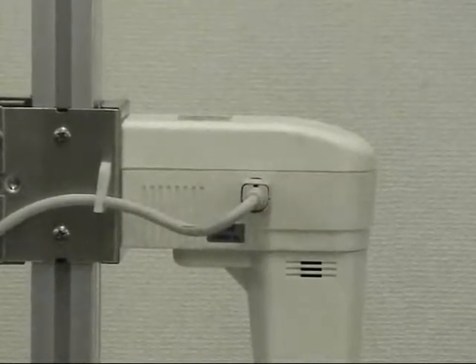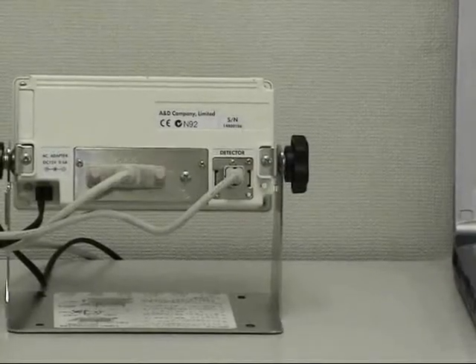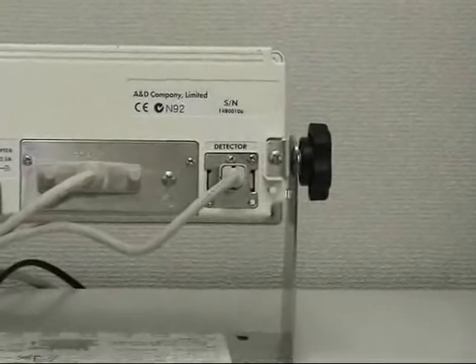For accurate viscosity measurement, confirm that the main unit and the display unit carry the same serial number before use.